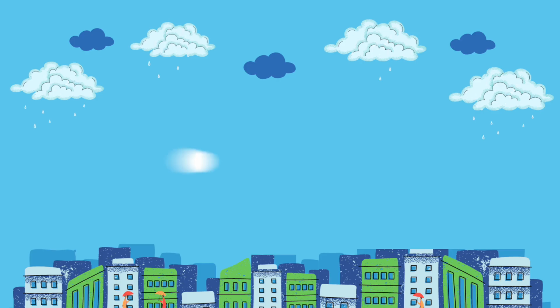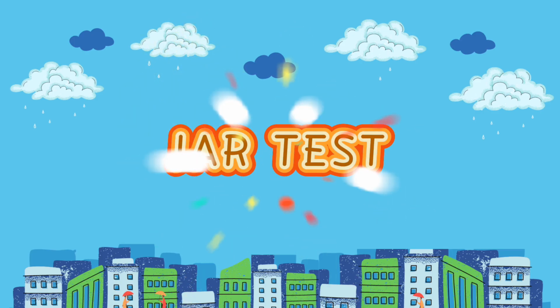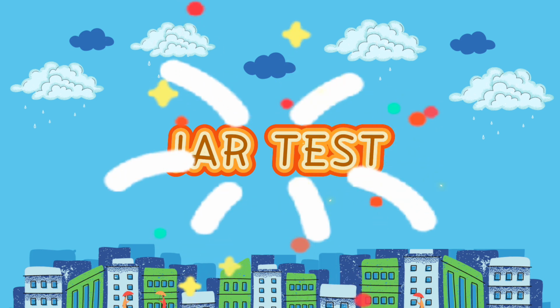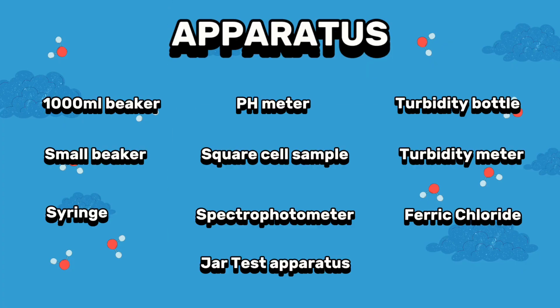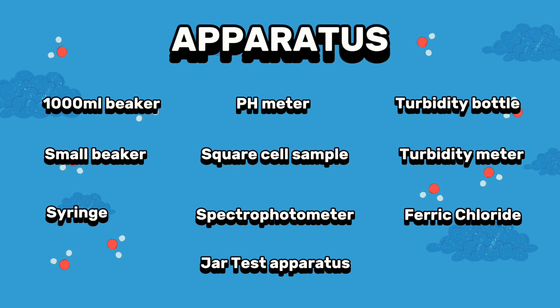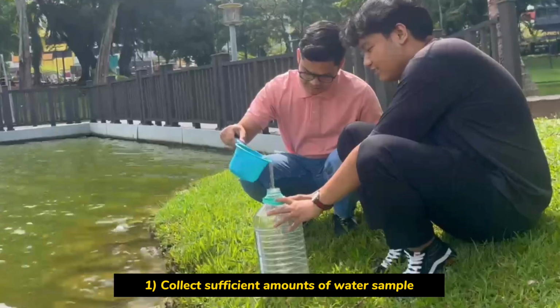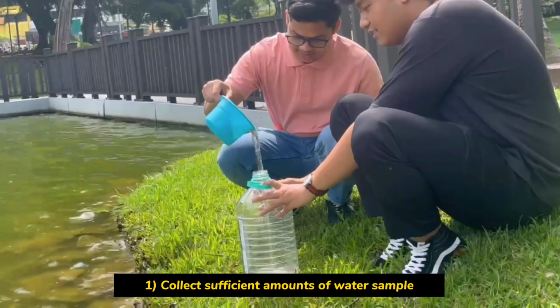In this video, the test that we will conduct to reduce the turbidity of the water sample is the jar test. So this is the list of apparatus that we need. Collect a sufficient amount of water sample at Tasik Shah Alam.